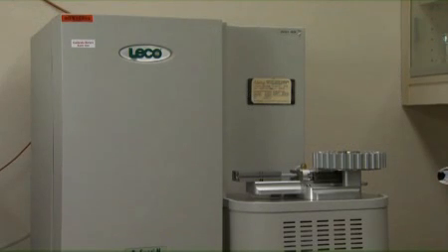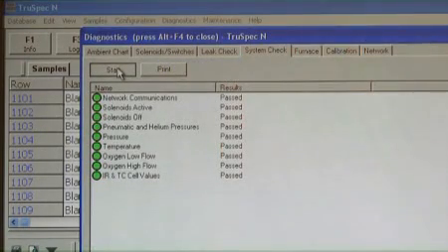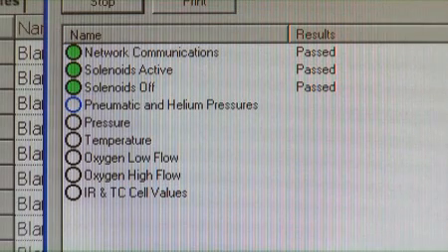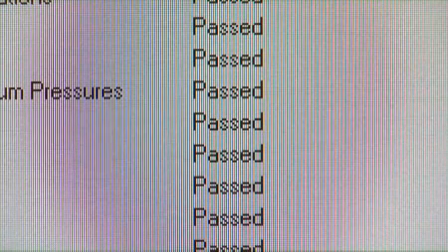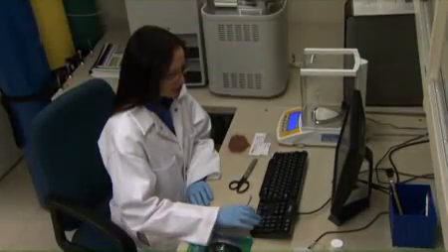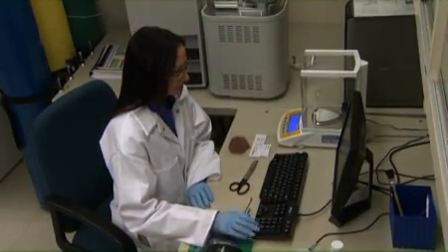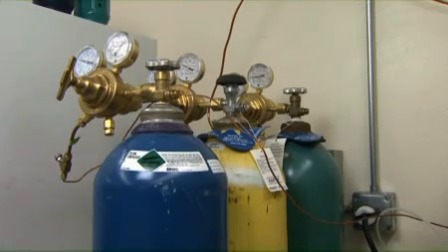To ensure that the overall system is operating satisfactorily, a system scan is performed daily or with use. From the Diagnostics menu, select System Check, then Start. Check the results of all systems. The circle in front of the system name should be green, and in the Results column, all systems should indicate Passed. In the event that any of the systems fail, maintenance or repair on that particular item is probably necessary. In addition to the system check, the flow and combustion areas of the system must be checked for leaks daily or with use. A gas leak will prevent the LECO from operating properly, if at all.